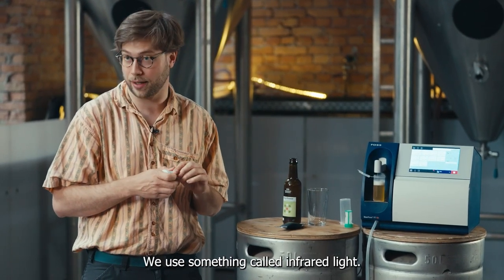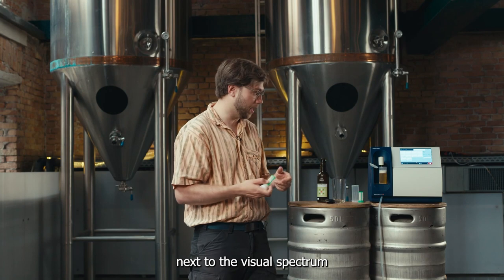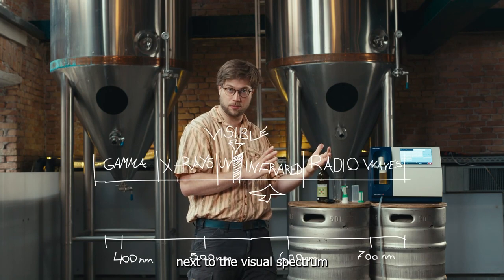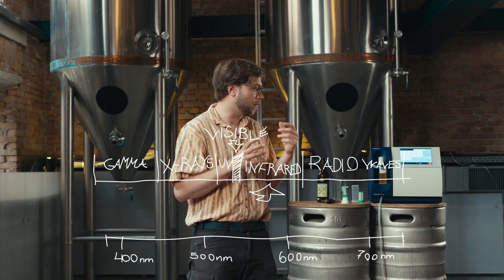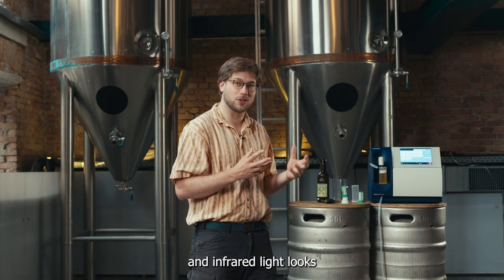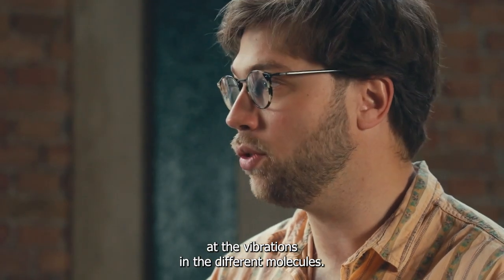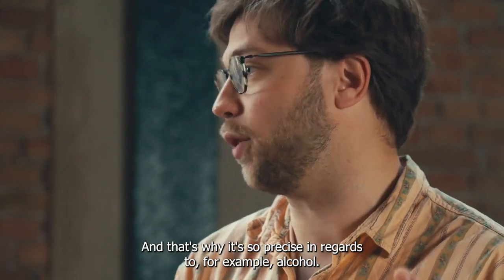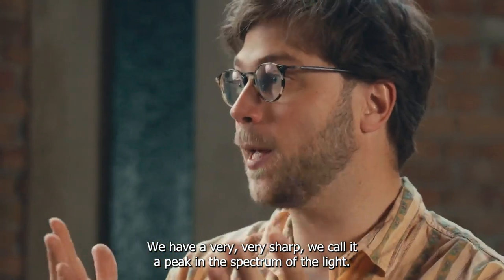We use something called infrared light, and infrared light comes from just next to the visual spectrum where human eyes can't see. Infrared light looks at the vibrations in the different molecules, and that's why it's so precise — for example, with alcohol, you have a very sharp peak in the spectrum of the light.